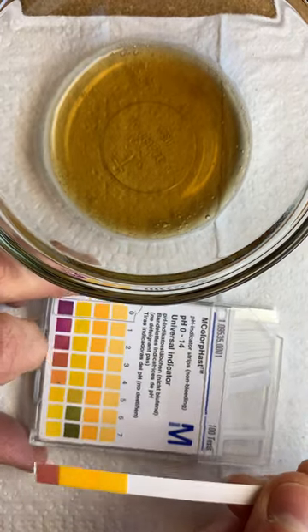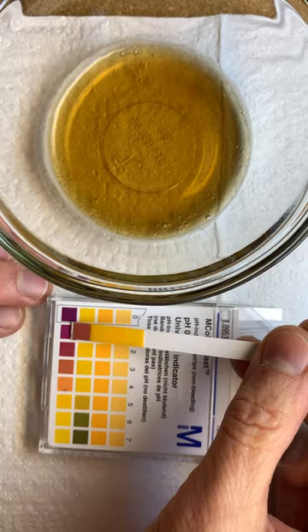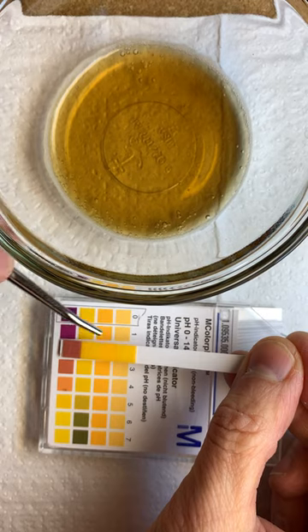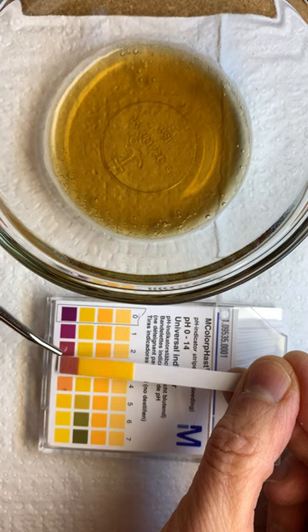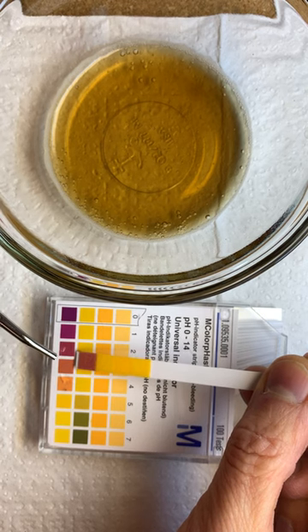Let's look at the acid side and see if we can match one. Does it really match zero? No. Does it match this column here? Not much. Oh, now we're getting closer. You see where this color is starting to match this color. And there's number three.